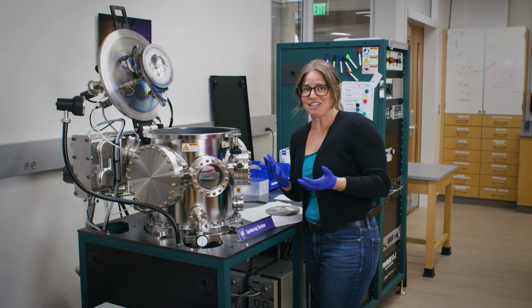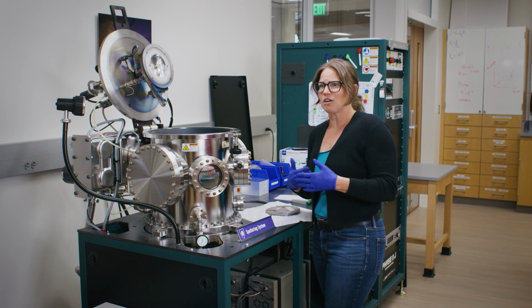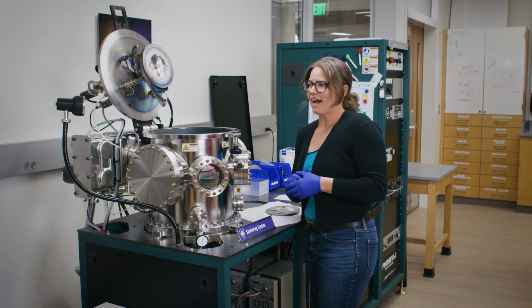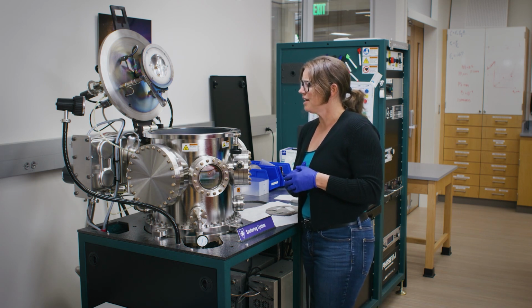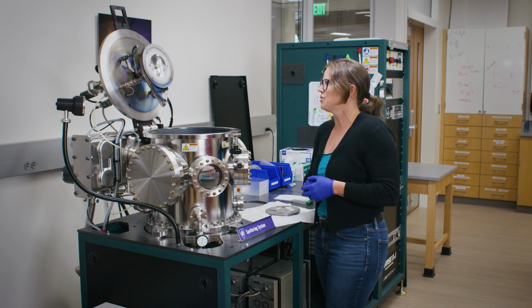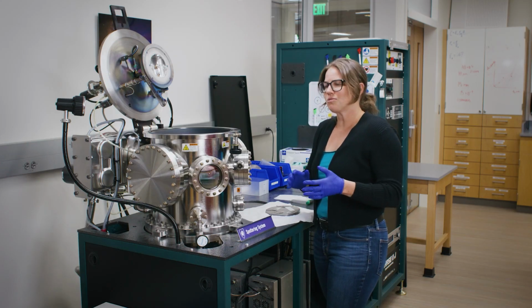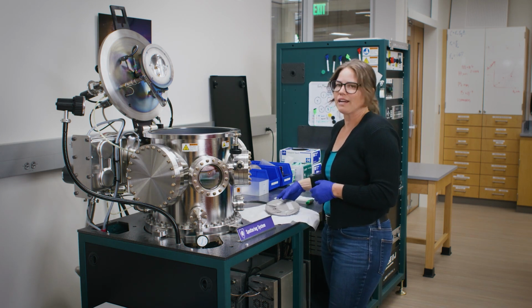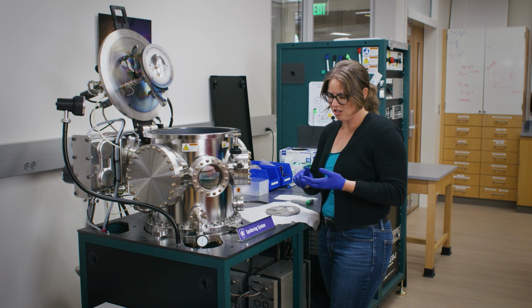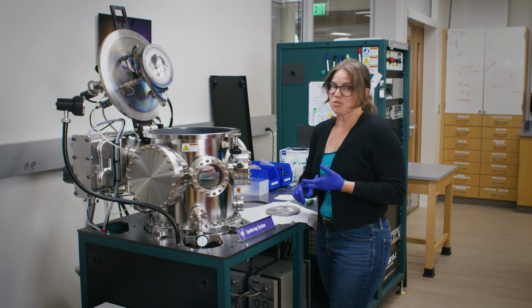This is a fancy oven with a lot of buttons that we can push. First, we evacuate all the air, then we put an inert gas on the inside. We're going to be using argon today. And then we choose which of the sources we want to use. We actually have a heater up here that we won't be using today, but we could use if we wanted to. And we load our substrate in. So we can basically play with pressure, temperature, and as well as the power of the tool.